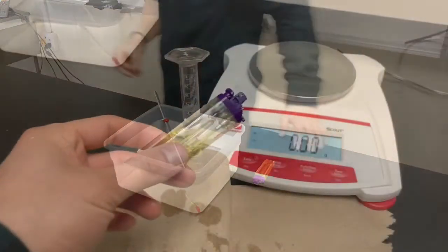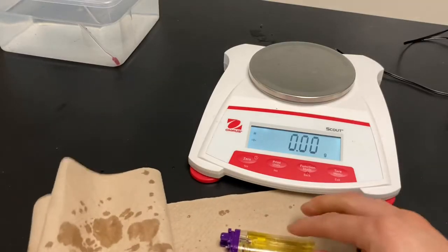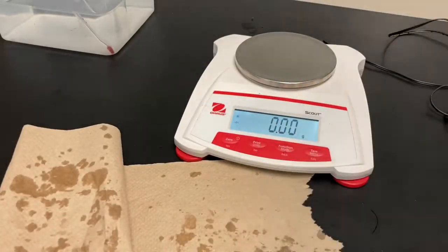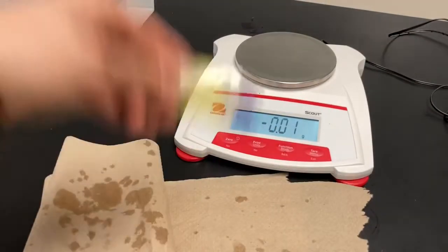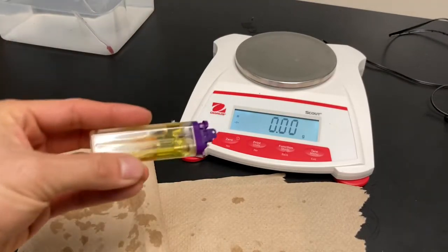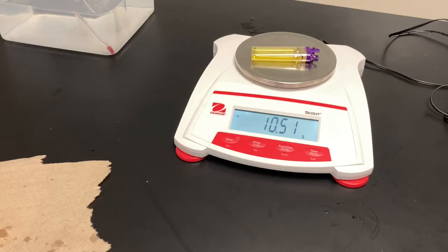Now I need to dry the lighter and measure it again to calculate how much butane was used — the mass of butane I collected. I'm shaking it off to make sure I get all the water out, because leftover water could affect my data. The final mass of the lighter is 10.51 grams. I'll use that to figure out the mass of butane that was used.